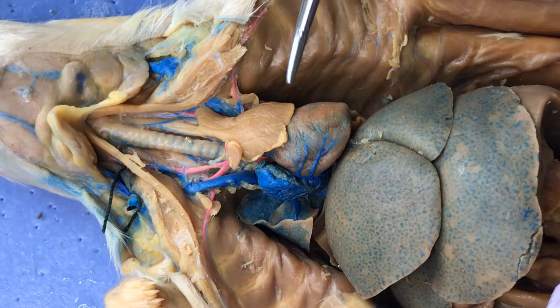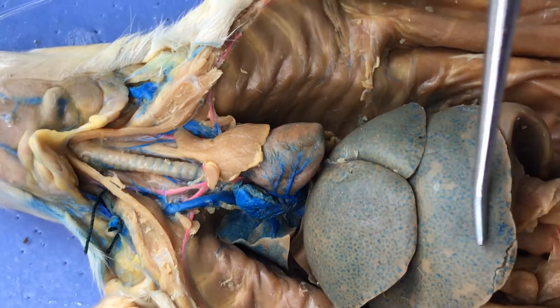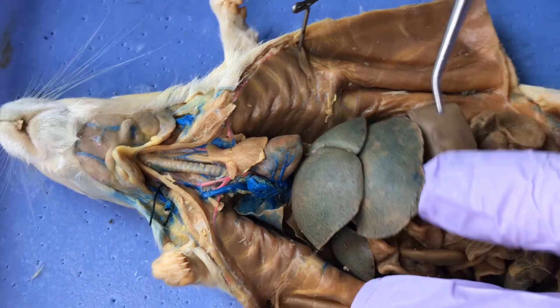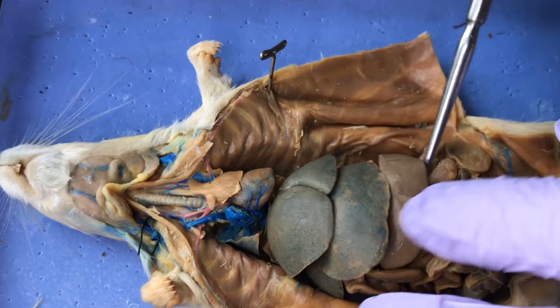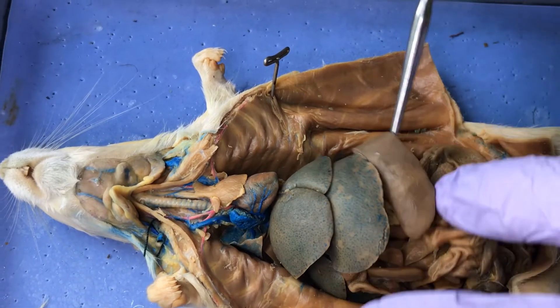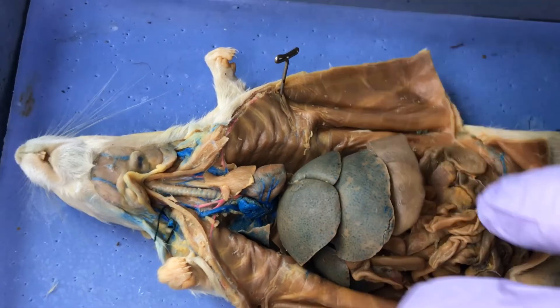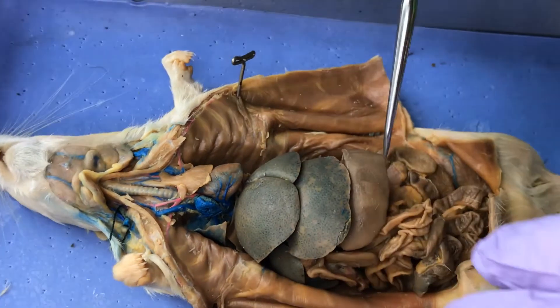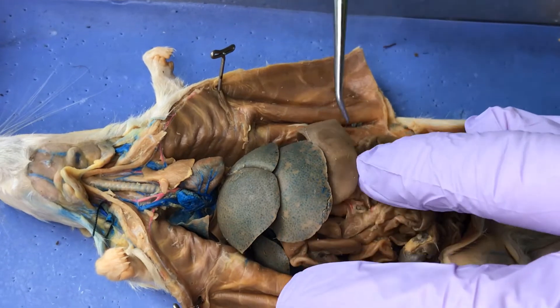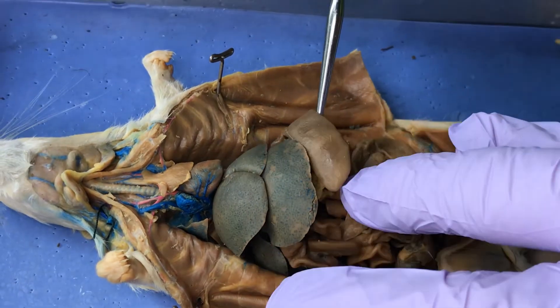Here's the liver — that's not an endocrine gland. Here's this big strap-like thing called the spleen, which functions in your immune system.